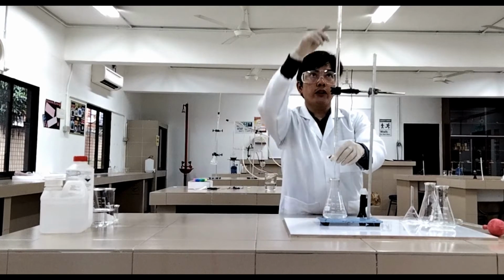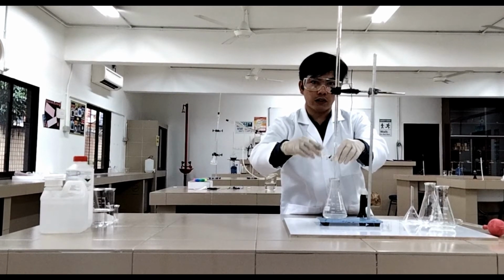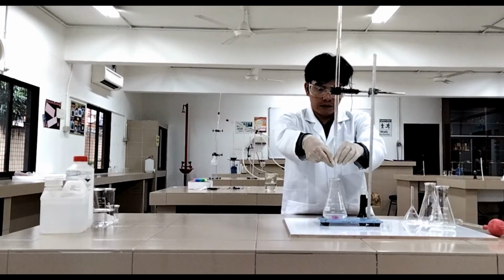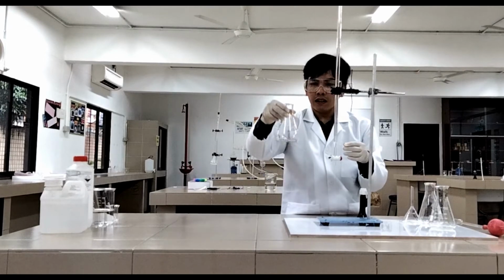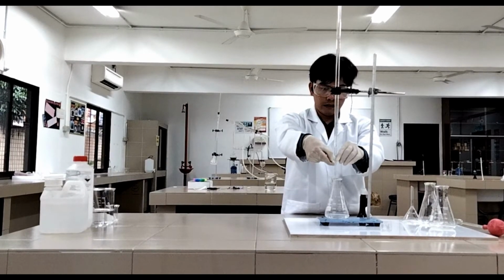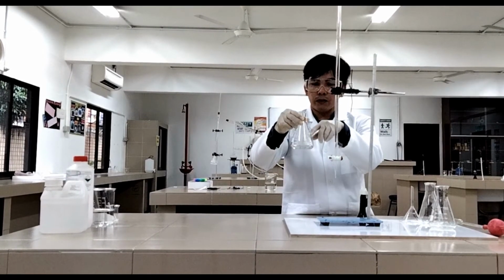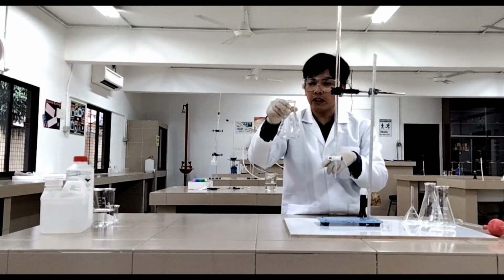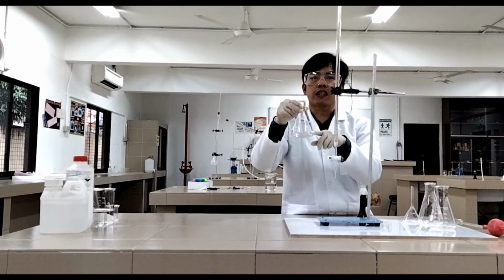Okay. So let's start. For you to put the liquid inside, you just have to twist this. It can be clockwise or anti-clockwise. So let's do it clockwise because it is more comfortable for us. As you can see, once we put the sodium hydroxide here, it's turning pink. Okay. Look again. It turns pink, but when we shake it, it becomes colorless. The reason is, if you drop the sodium hydroxide there, some part becomes alkaline already. But when you shake it, when you distribute it, it turns colorless again. It means the sodium hydroxide is still not enough to neutralize the acid.